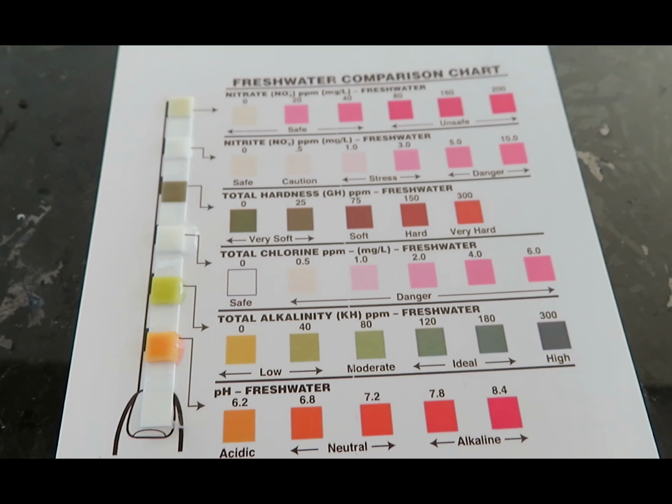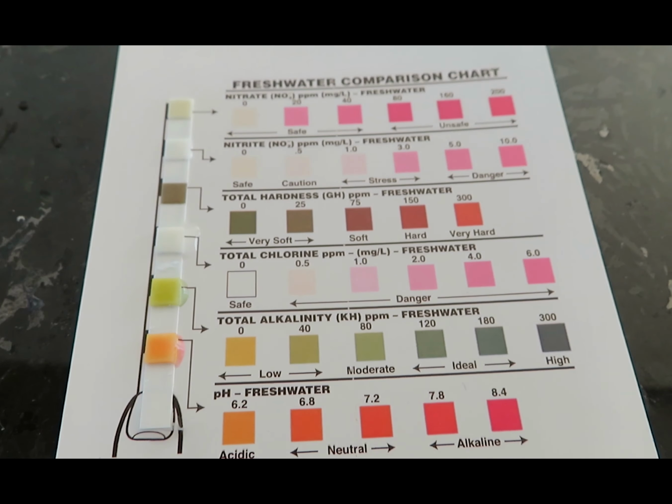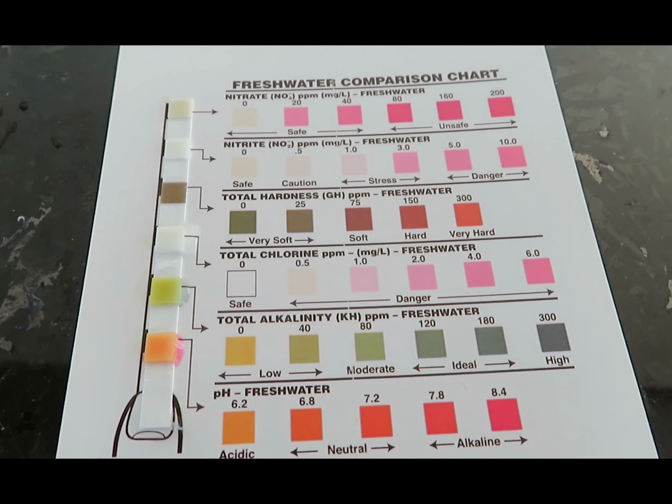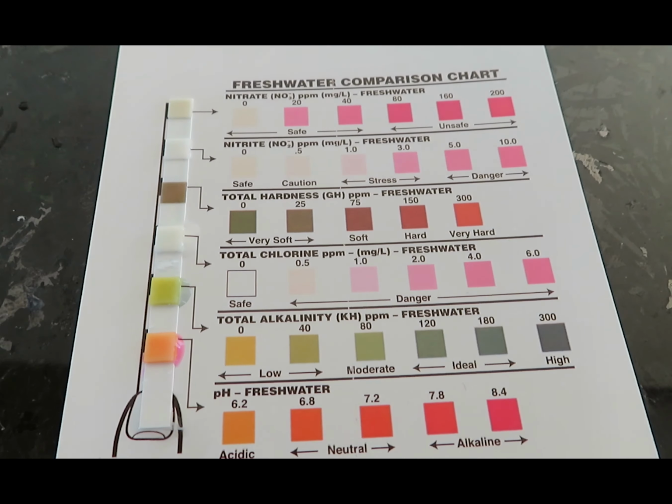There was some variation in the upper to lower river water samples that I took. A couple key notes is that the upper river was actually more acidic compared to the lower river, and that the alkalinity in the headwaters was actually higher compared to the lower area of the river, which means that somewhere along the process, there was probably an increase of acids in the water that neutralized that alkalinity capability in the water.